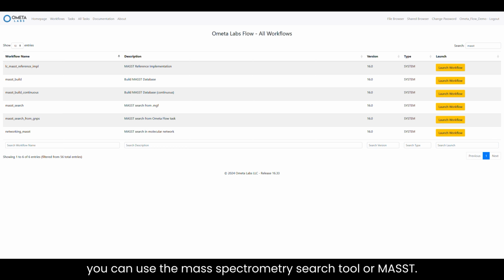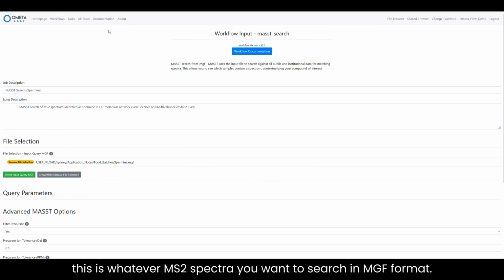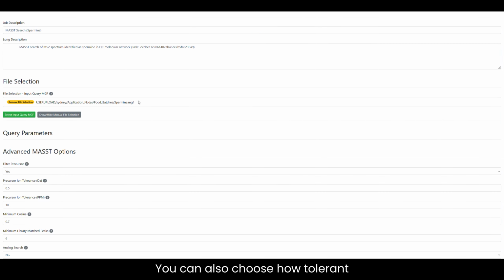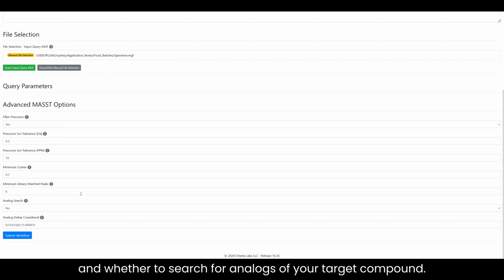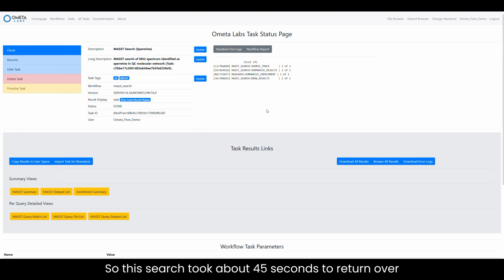For this, you can use the Mass Spectrometry Search Tool, or MASST. For today, we're going to do a MASST search for spermine, but you can use MASST to search any MS2 spectra, whether it has a library match or not. There are a couple of ways to do this in Ometa Flow, but for today we're going to use the standalone workflow right here. All you need for this is whatever MS2 spectra you want to search in MGF format. You can also choose how tolerant you want your search parameters to be and whether to search for analogs of your target compound. So this search took about 45 seconds to return over 1,000 matches to our spectrum.